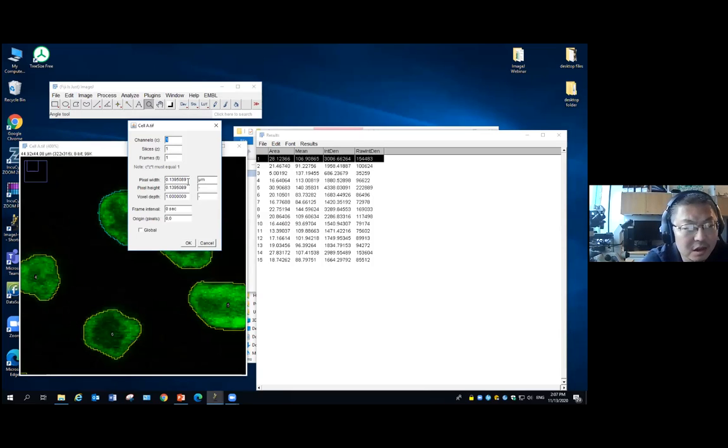That's 140 nanometer. This is taken under a confocal microscope. So now we will know here, when the area is 28, what is the unit? That's the micron square. Okay. So we need to know this is the micron square.